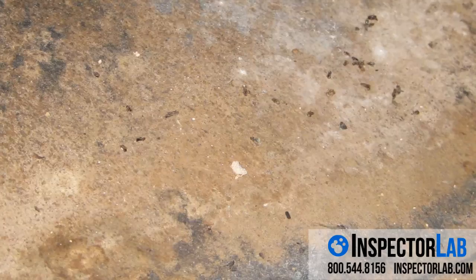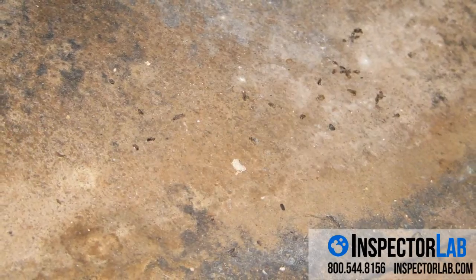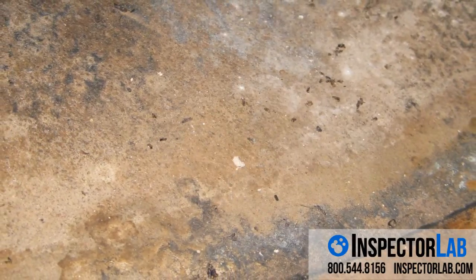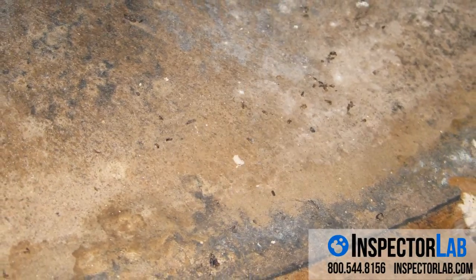Bulk samples will reveal the kind of mold on the surface and whether or not there is presence of current or former mold growth. It is not possible to determine how long the mold growth has been growing or if it is currently growing. If the surface is wet, mold growth is likely active. However, if the surface is dry, there may not be current growth.